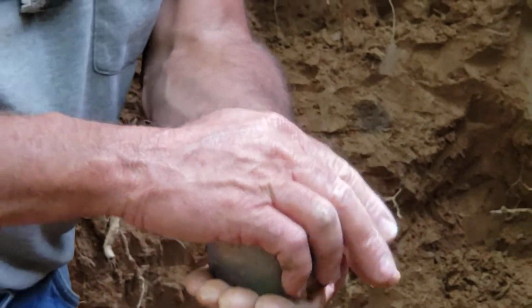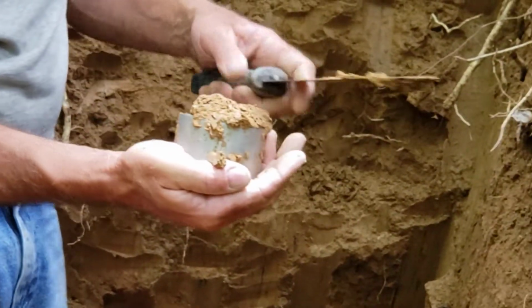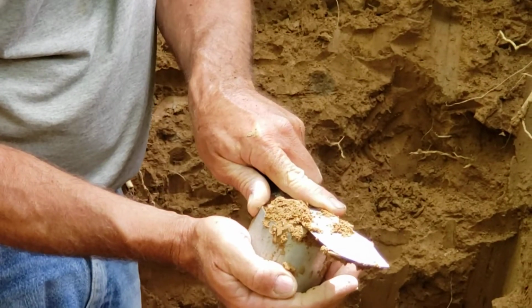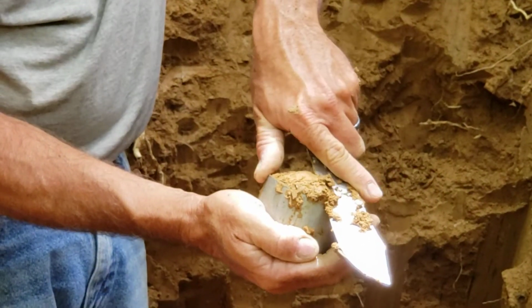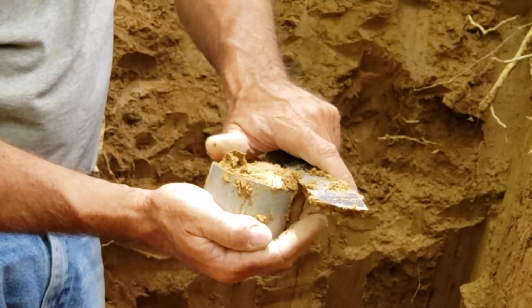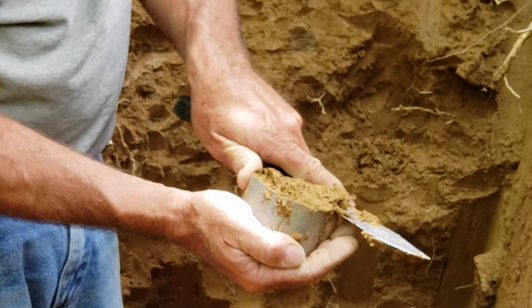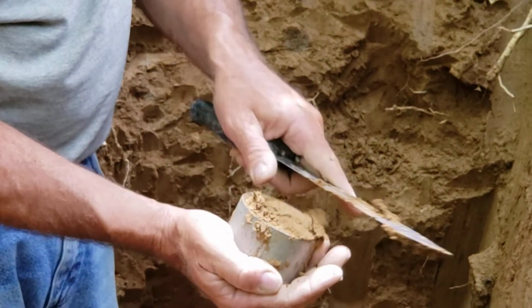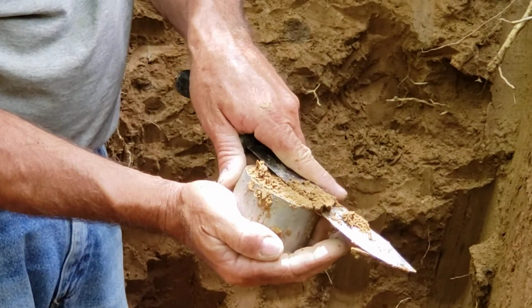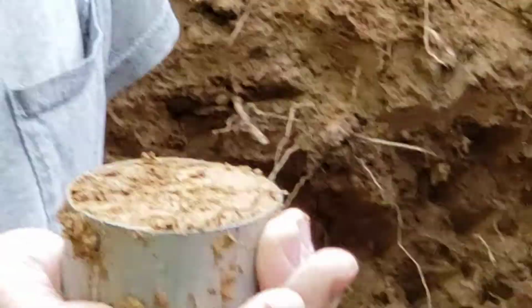We want to look at this back side, but when you turn this over, you have to be careful that the material that's loose on the front doesn't fall out. So put your hand over that. And then you can take your knife and start shaving this material off this side, but you have to be careful that you don't take material out of the middle of the ring or off the edge of the ring that's part of the sample. You want this flush all the way across, and this is coming out really nice. It doesn't always work this way. So that's really what you want right there.